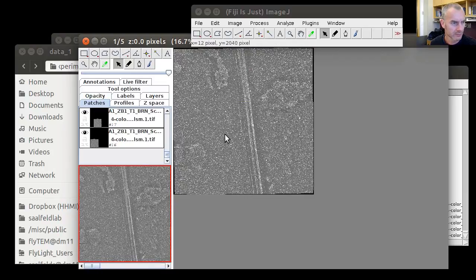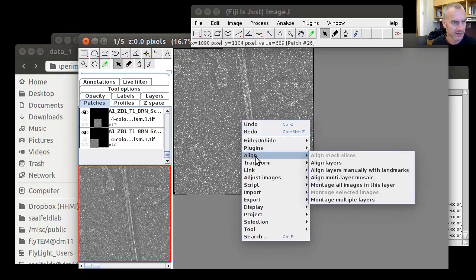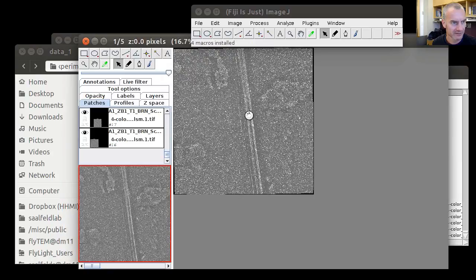There's one thing to note: while the implementation in TrakEM2 calculates montages on the way to get these lens correction models, it doesn't apply them to the montages that we see here in the canvas. So before we can get a visual impression, we will have to do that again. So we montage multiple layers as we did before, 1 to 5. We can stick with the parameter choices that we made before.